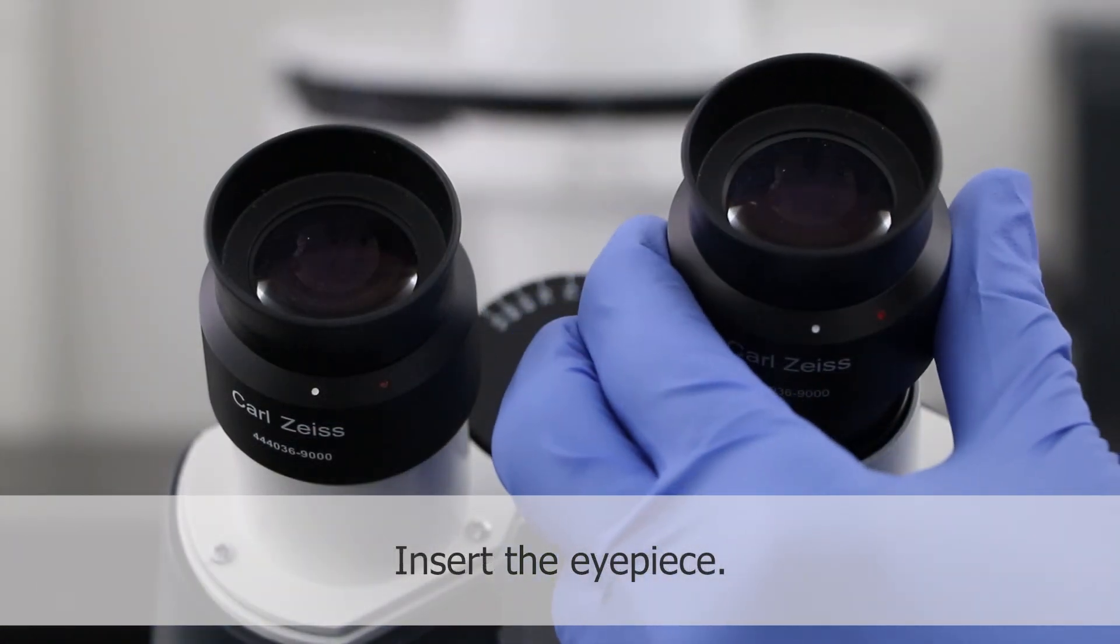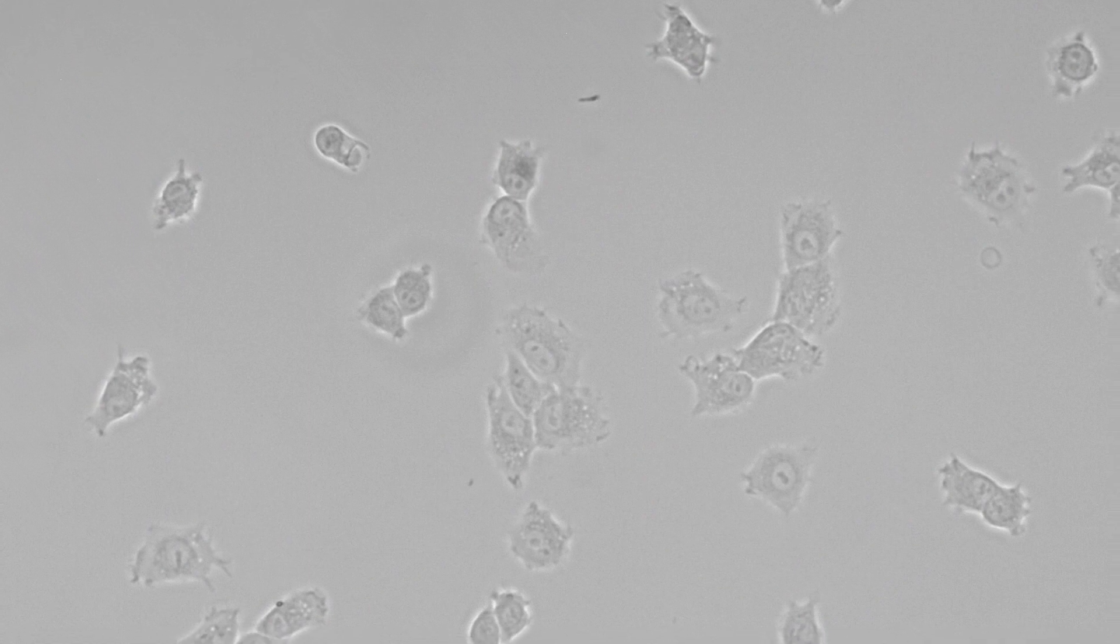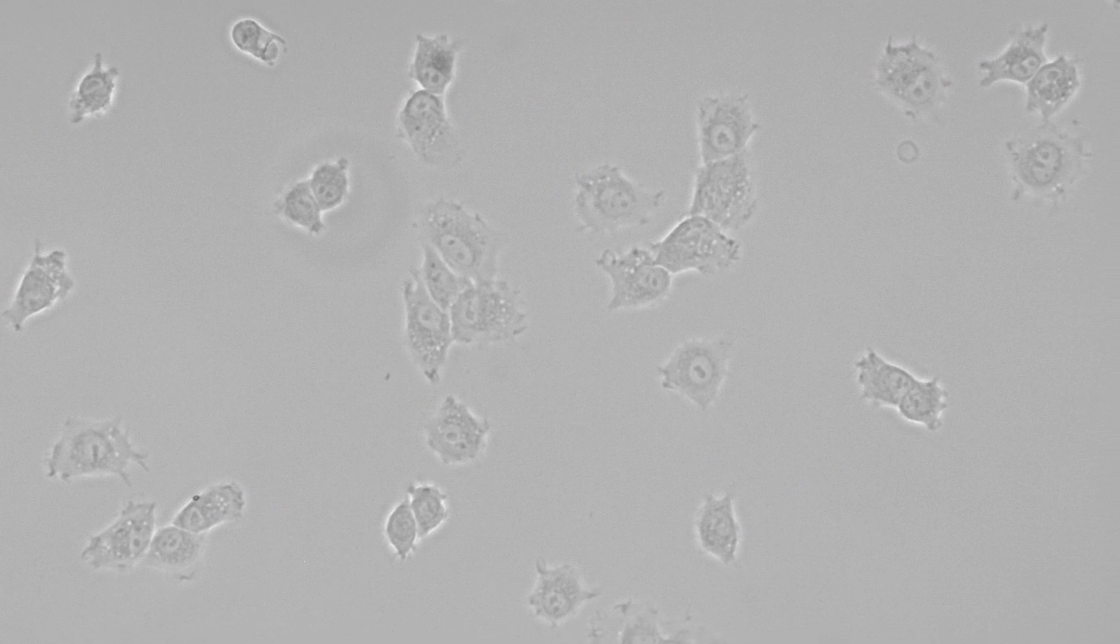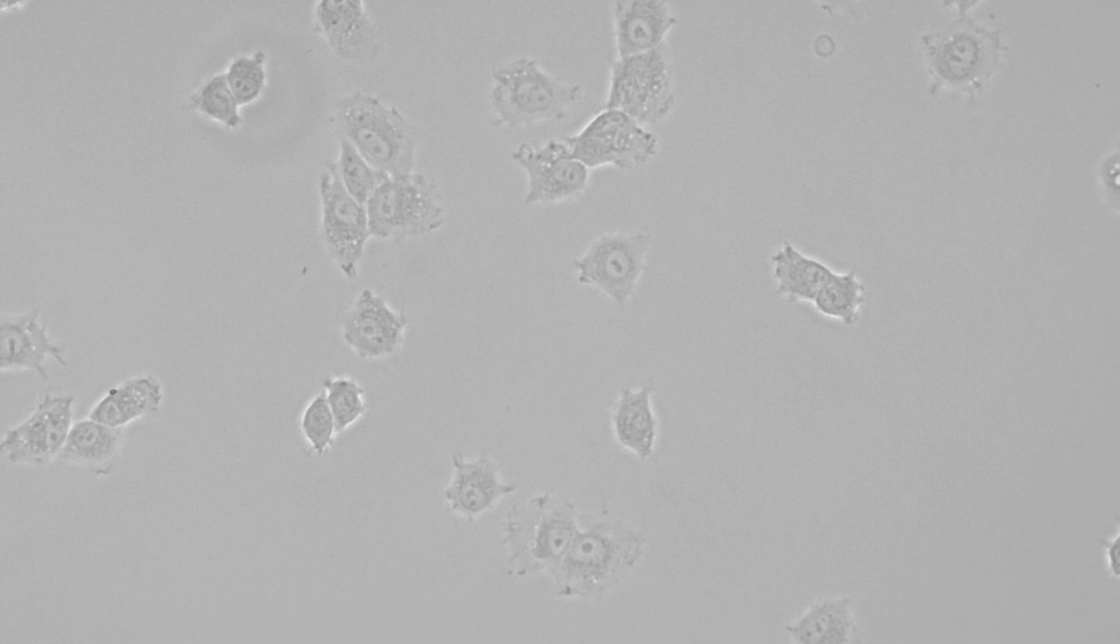Insert the eyepiece. Well done! Your microscope is optimally aligned for Brightfield examinations now.